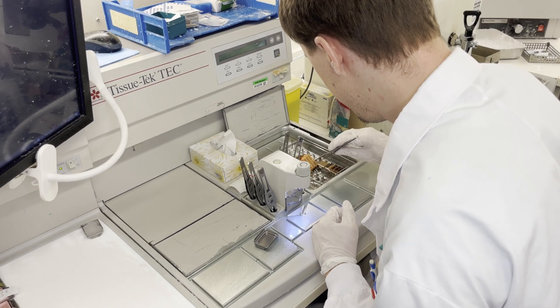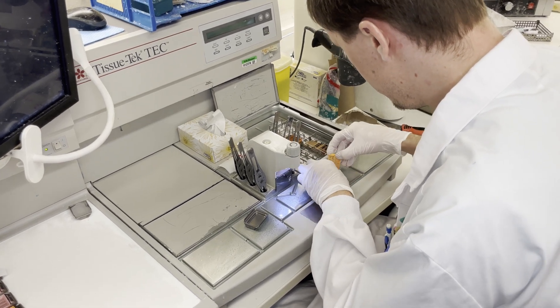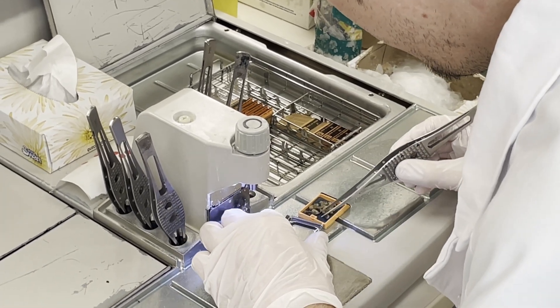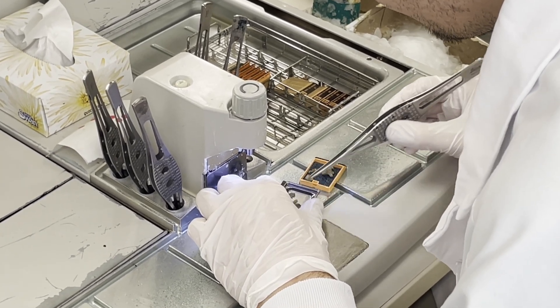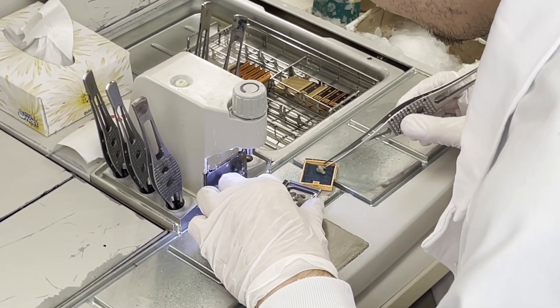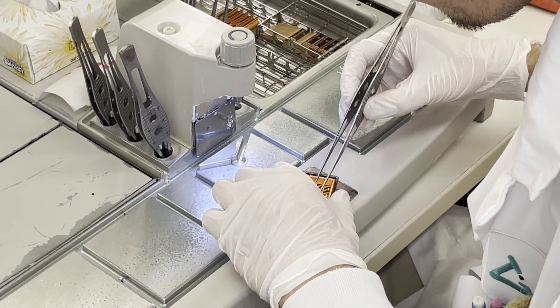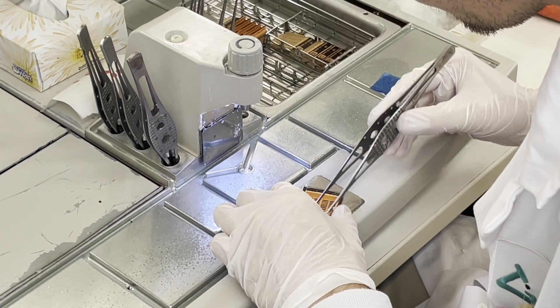Next, the cassettes are moved to an embedding station where a technologist places each piece of tissue in liquid wax, forming a wax block around the tissue sample.